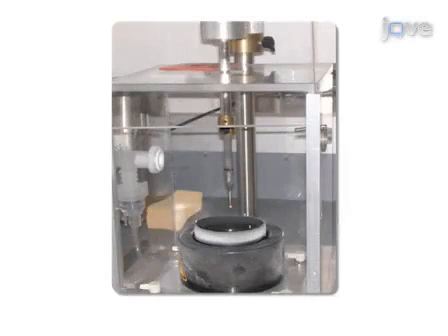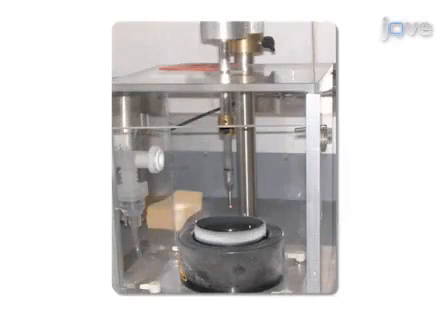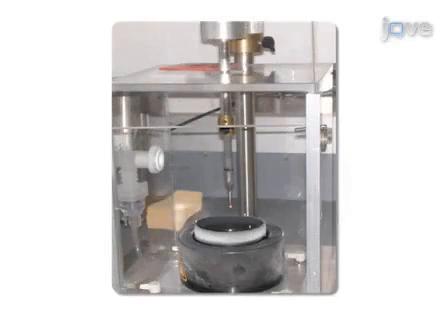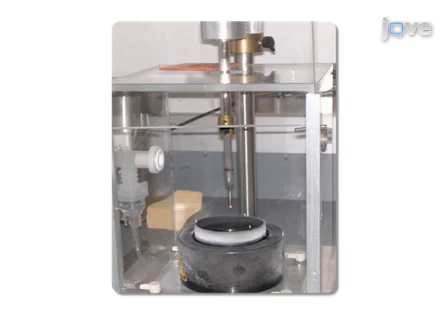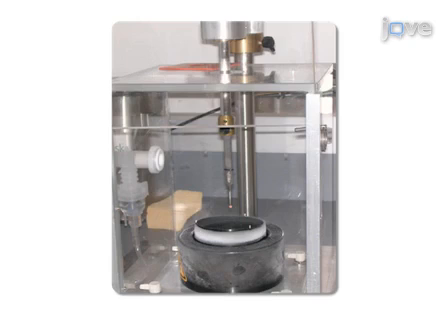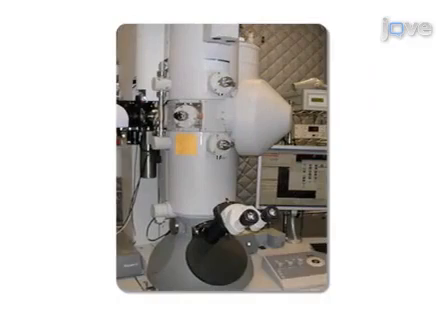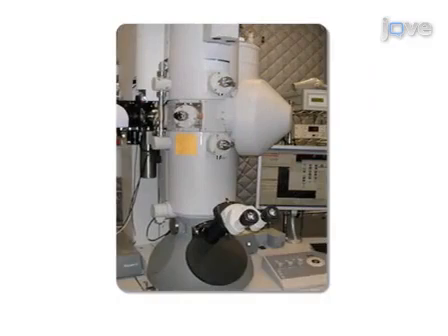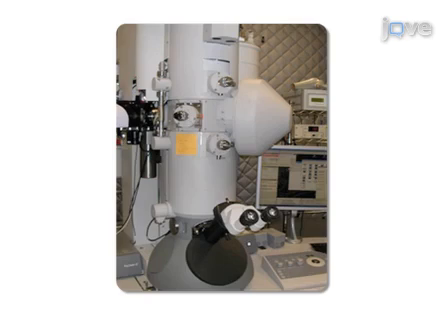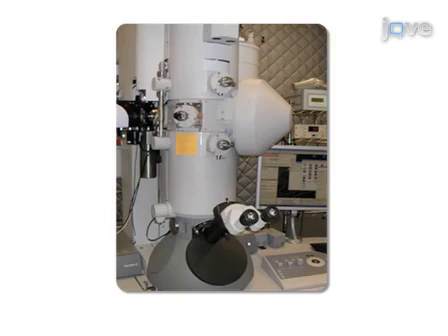The protocol begins with cryo-EM specimen preparation, using a rapid dilution and backside blotting method to transiently reduce the salt concentration when preparing the frozen hydrated EM grid. This process ensures protein stability while reducing background noise and improving the signal-to-noise ratio during the cryo-EM low-dose data collection that follows.